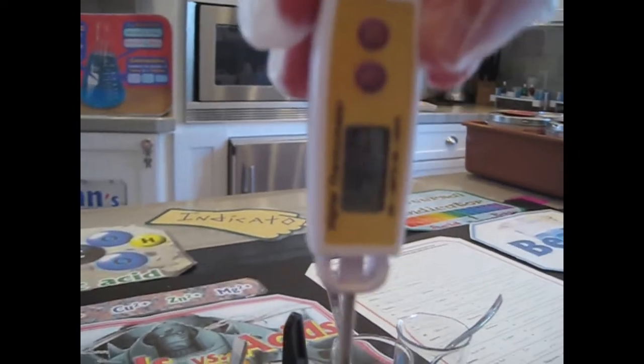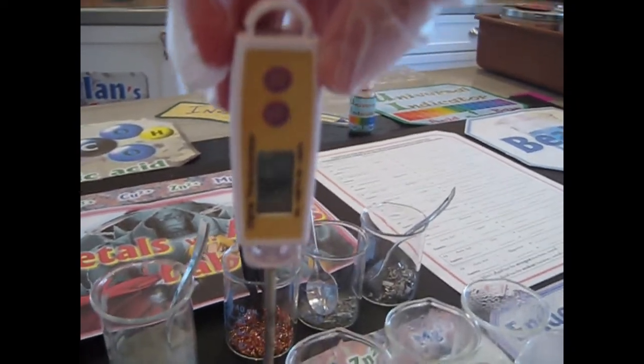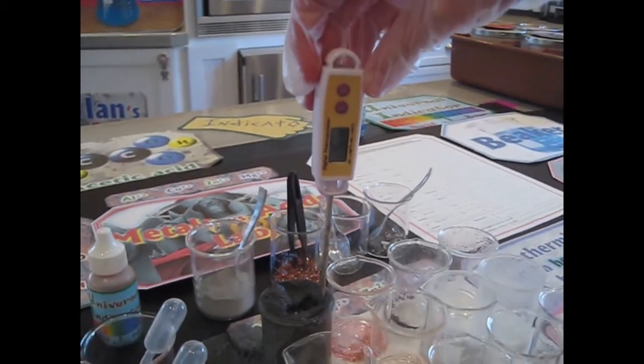Now, we waited a long time for this one. Just remember that these all started around 23 degrees. So this one, what would you say it is? 46.4. Okay.